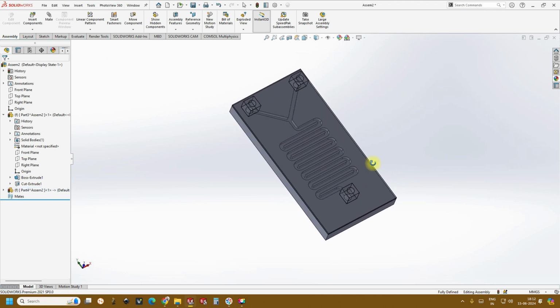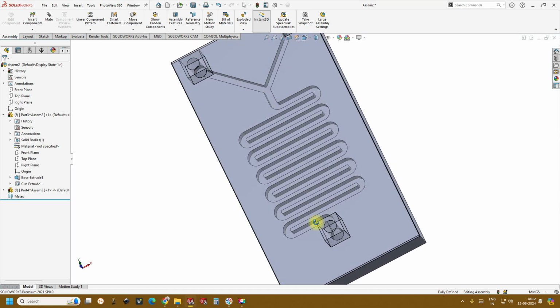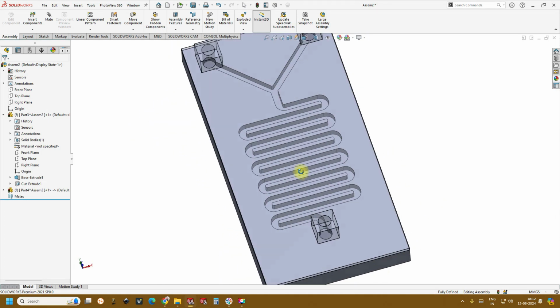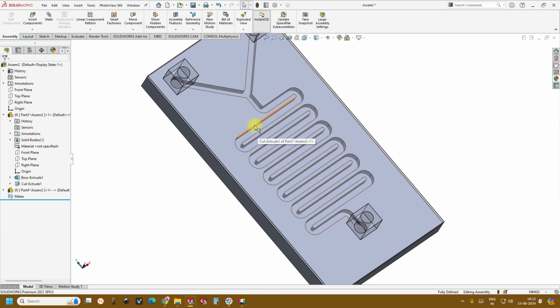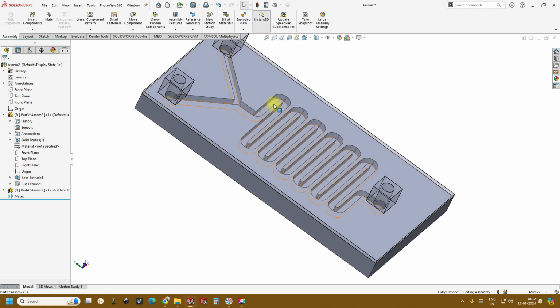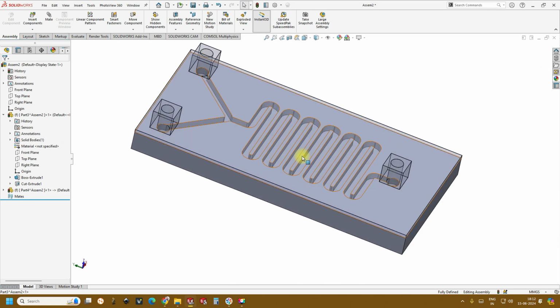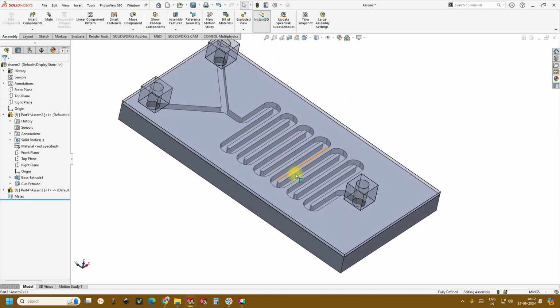So it's very easy. Yeah. So this is how it looks. Okay, and all these are really pretty easy. So the only thing you have to do is make sure of the channel length that you are interested in and the radius or the stress corner radius followed by the depth of the channels. So all these things are arbitrary, depending on the requirement or depending on the application, this can be changed.